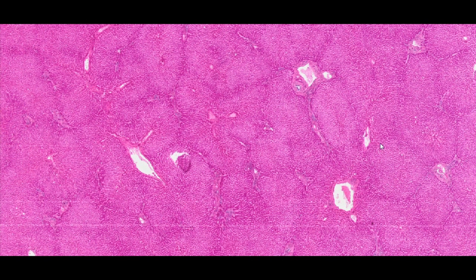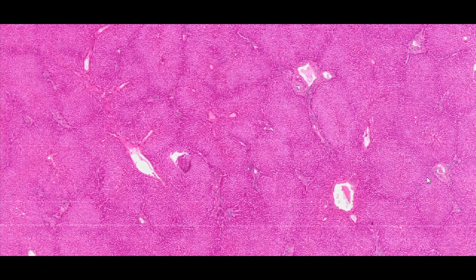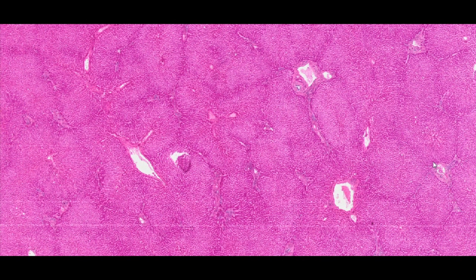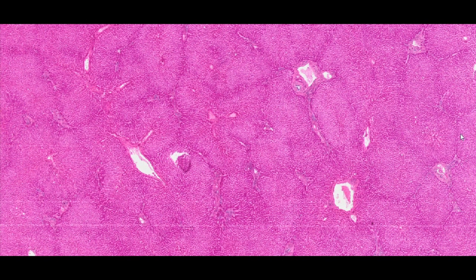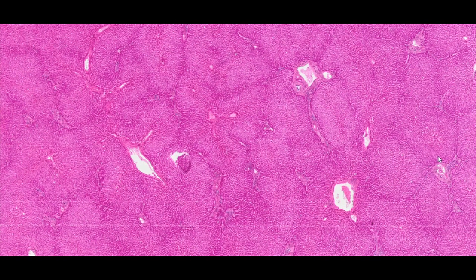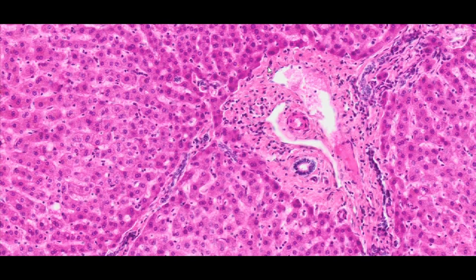Since connective tissue does not completely outline the lobules in the human liver, they are difficult to distinguish and the lobular structure is of more customary nature. The location of the central vein and the portobiliary spaces, where there is a relatively large amount of connective tissue, are considered the landmarks.